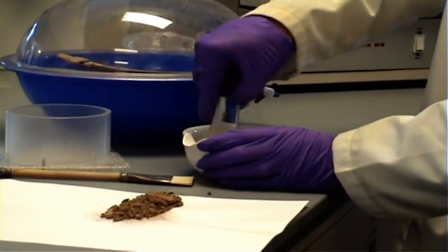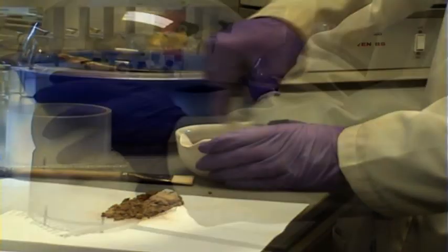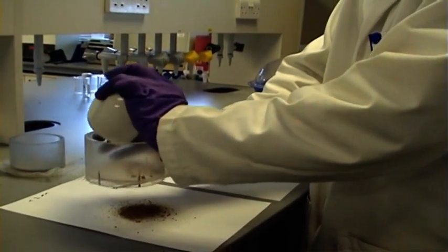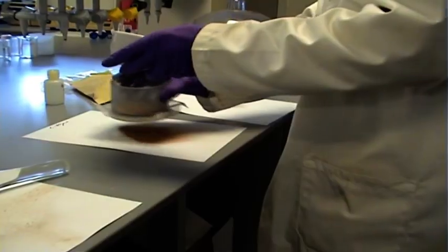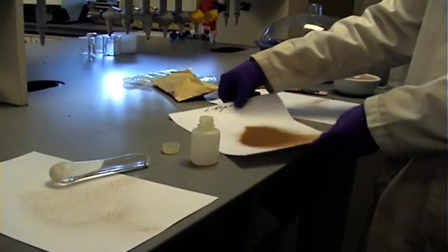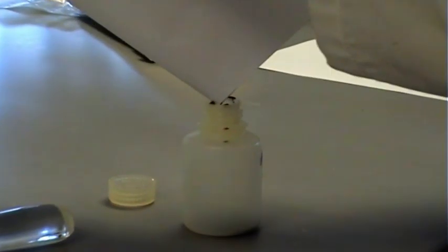To allow a more representative subsample to be taken, the dry sample is ground to reduce the particle size and then sieved to retain the smaller fraction. A typical particle size collected would be below 0.18 mm in diameter. The fine fraction collected is stored in a clean, dry sample bottle, which is clearly labelled.